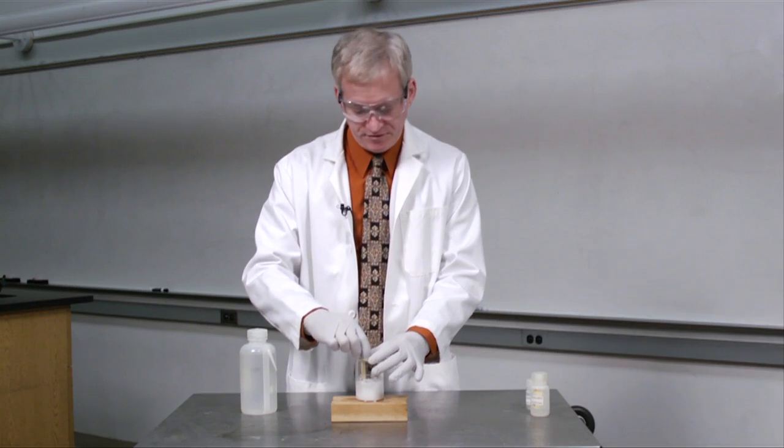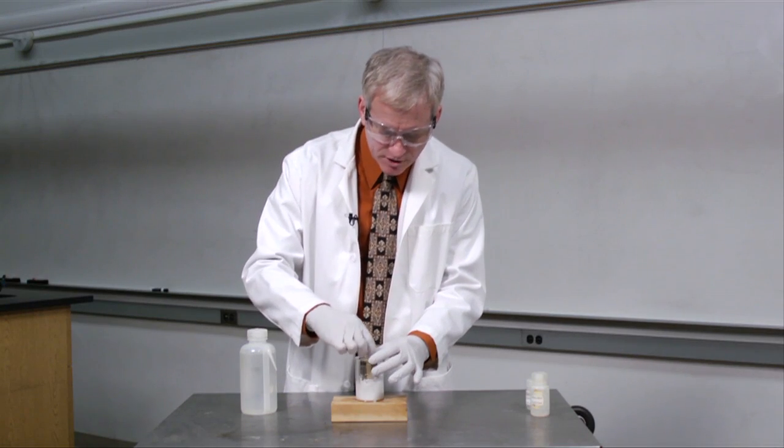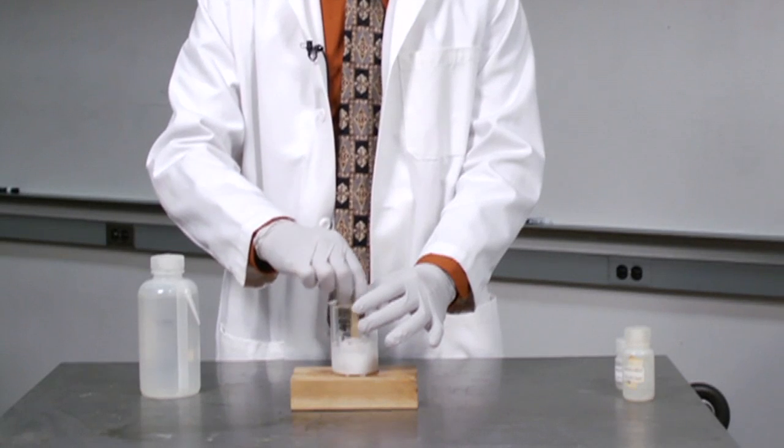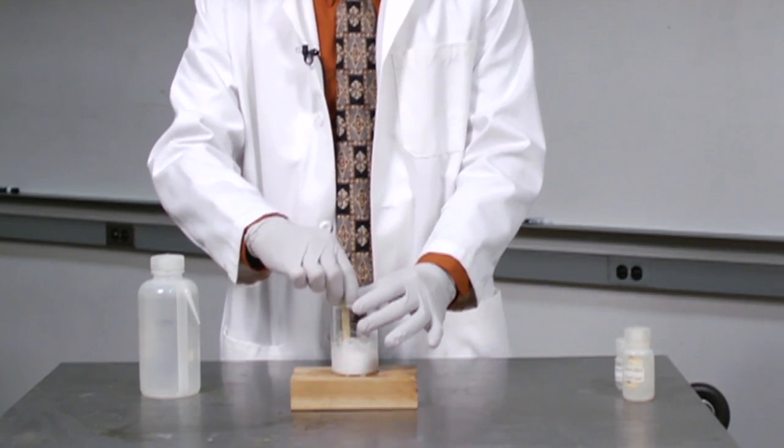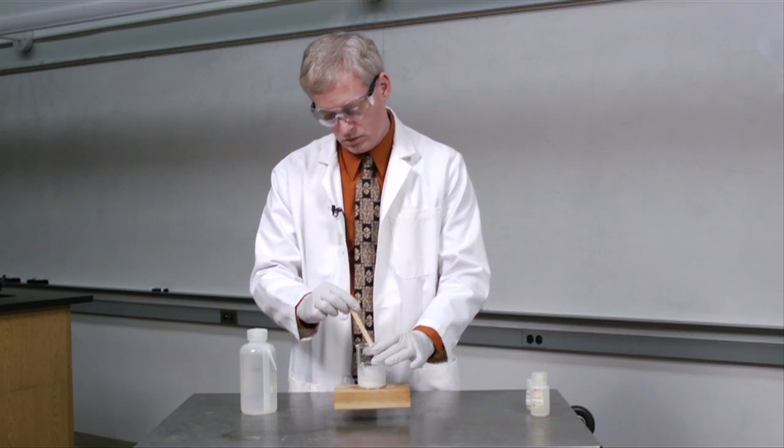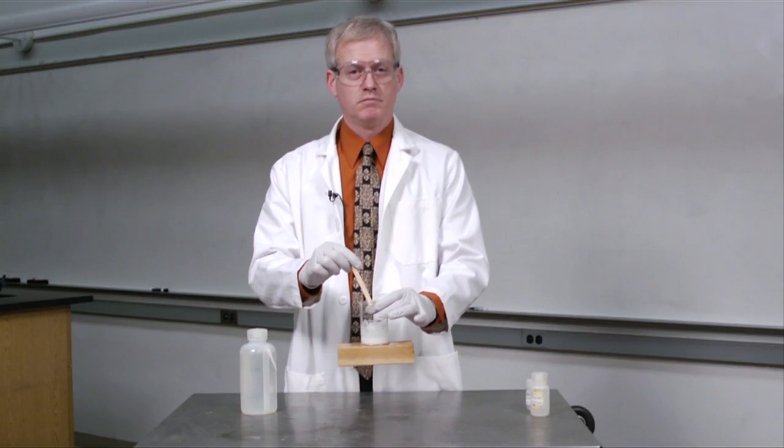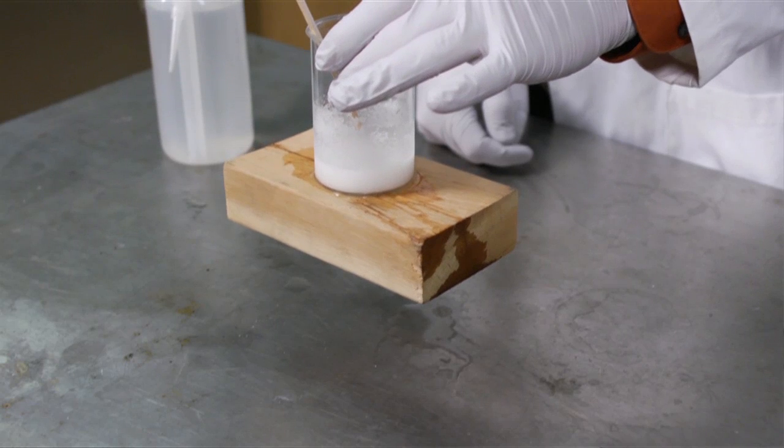And now, I have a fairly complete reaction. And if I lift the flask from the block, I can't lift the flask from the block.